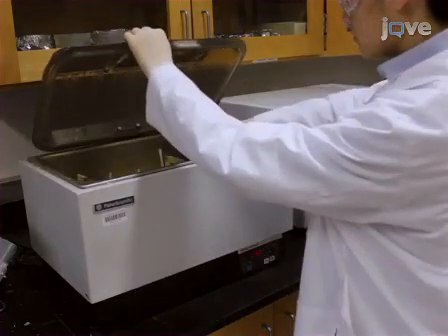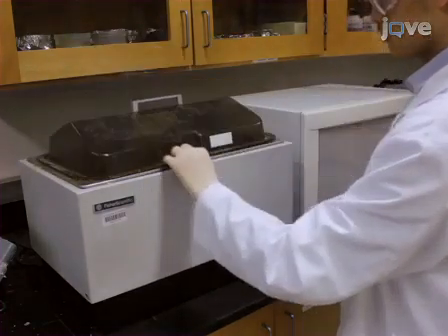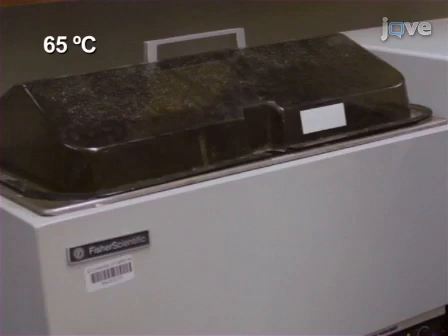Allow the agarose to cool by incubation in a 65 degrees Celsius water bath. Failure to do so will warp the gel tray.